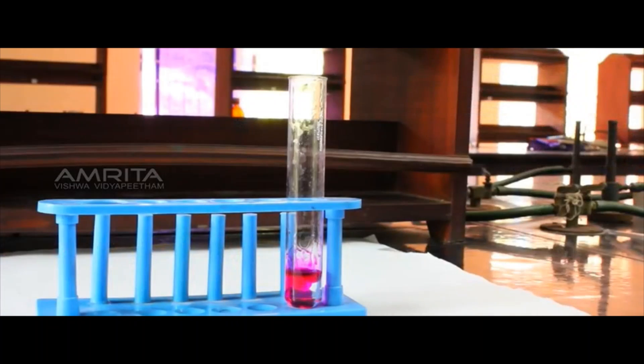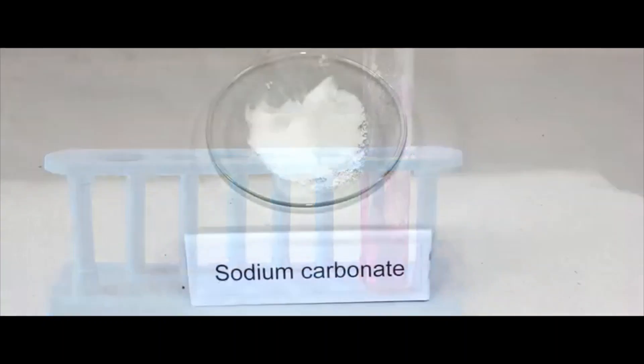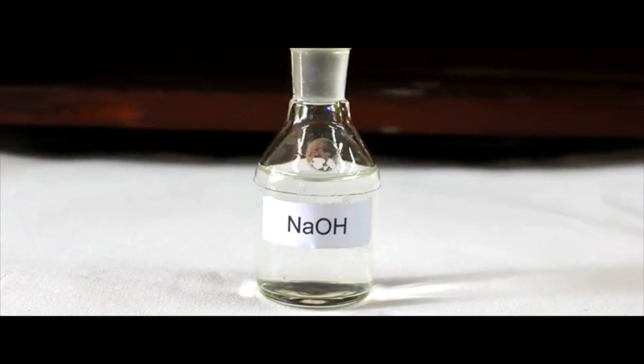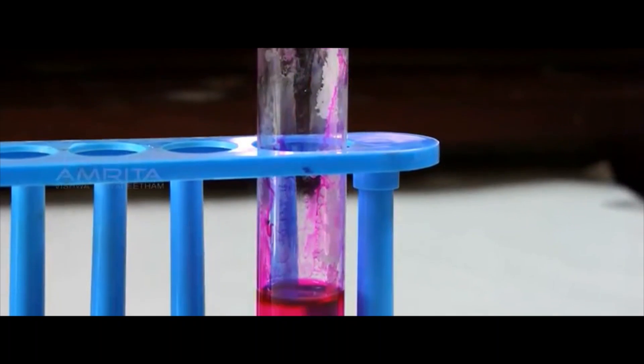You can observe that the color of this solution turns pink, which indicates that both sodium carbonate and NaOH do not react but form an alkaline solution.